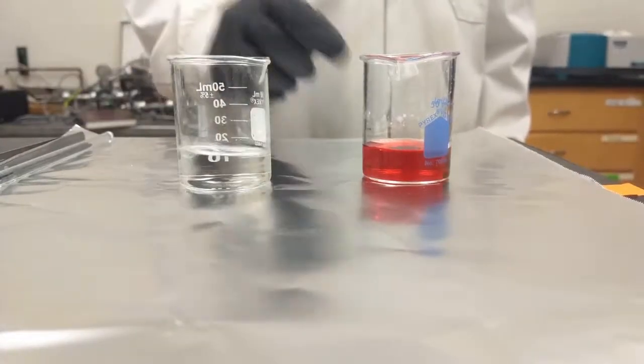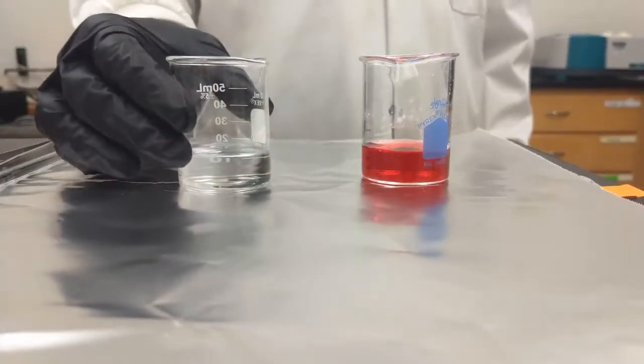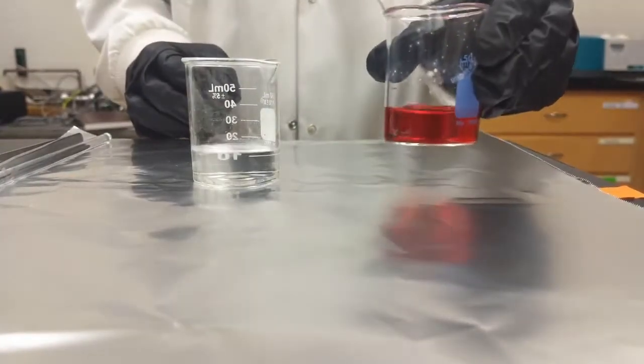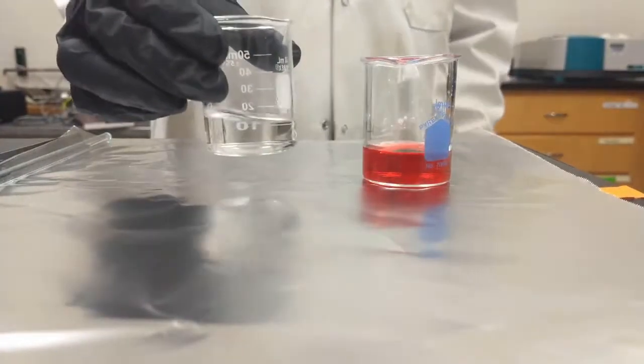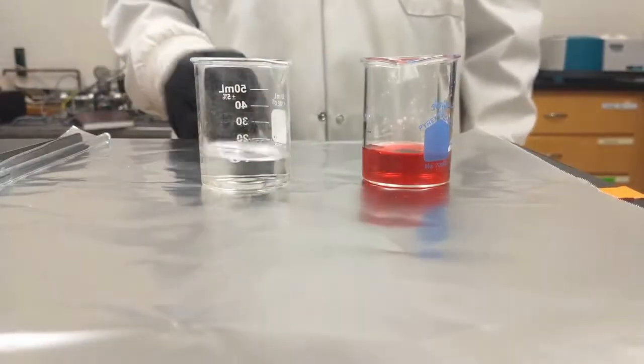Hexanes is less dense than water, so when I pour the contents of this beaker into the contents of this beaker, this one will stay on top as long as I pour it carefully.